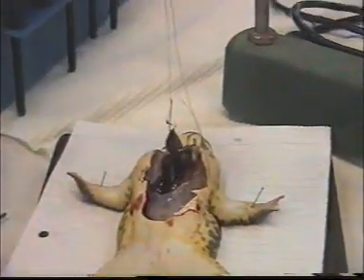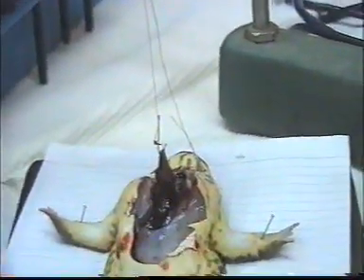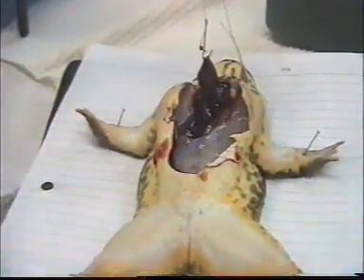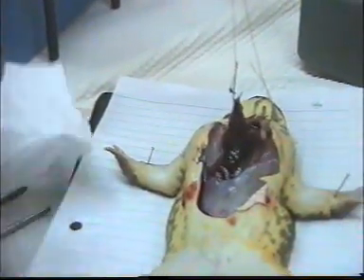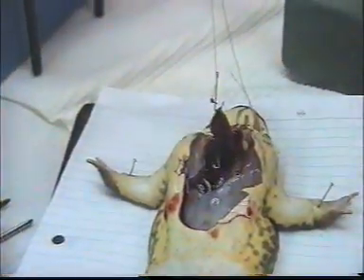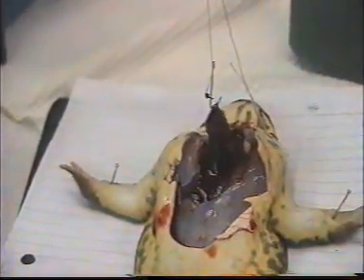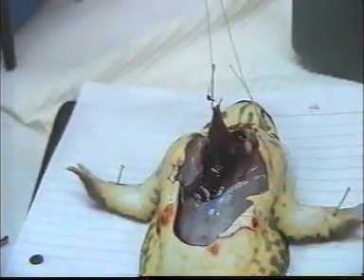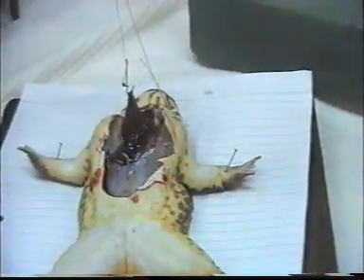Okay. Now the heart is beating. Normal heartbeat.